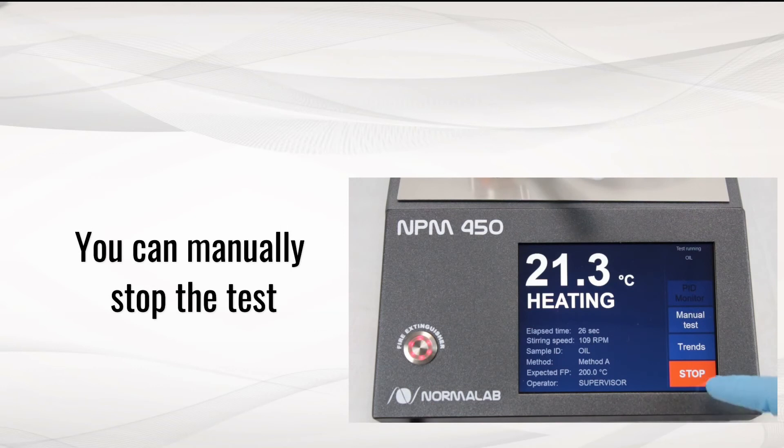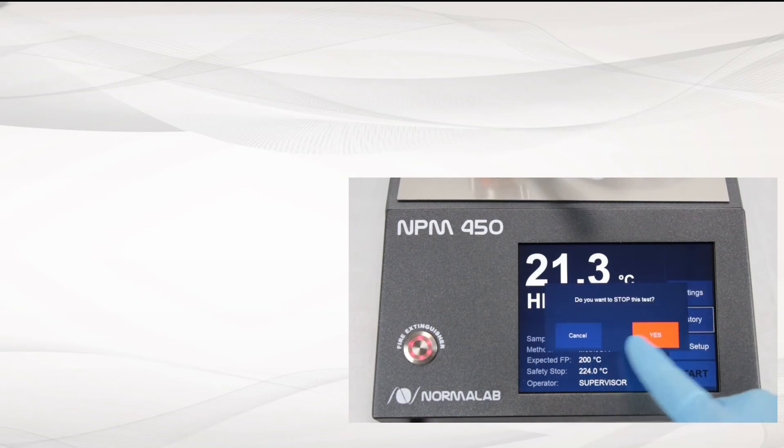You can manually stop the test by pushing the stop software button and validate your choice.